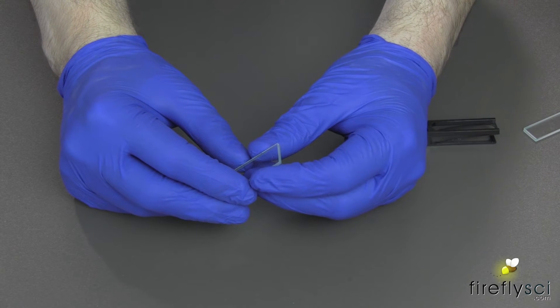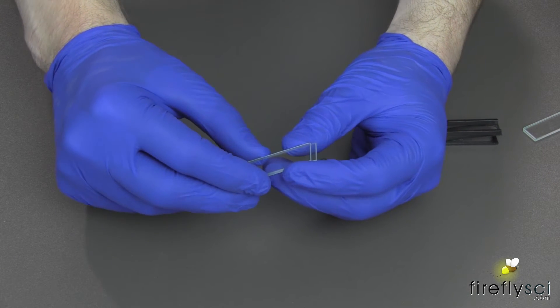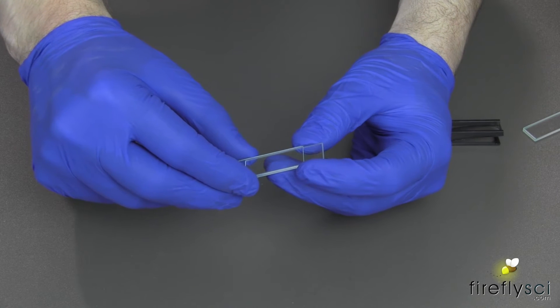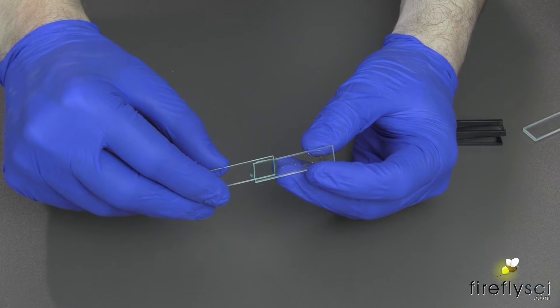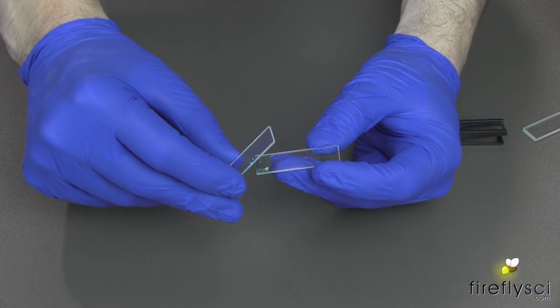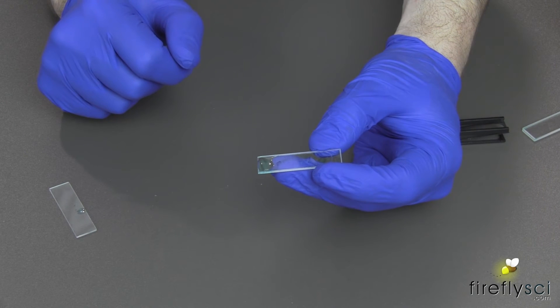Now to disassemble the Type 20, you slide the cover plate off the same way you put it on — simply slide it right off the top, making sure again that you have the groove plate on the bottom. You wind up with a nice bead right on the end there. Super easy to clean.